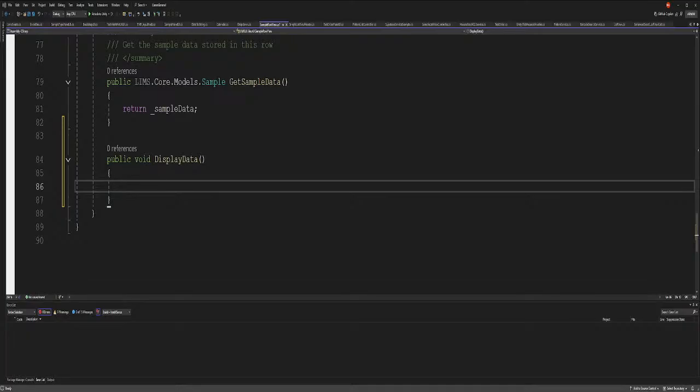So you kind of need to have a parent that will open that up and set the values to everything. So what we're gonna do is create an empty parent and call it sample window parent. Now we are gonna do another script, a UI script, and we're gonna call it sample parent window, so we know what it is.